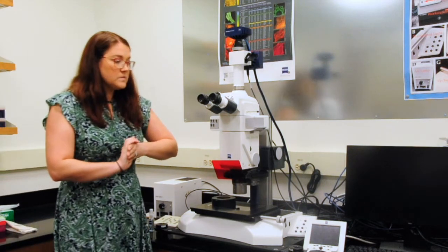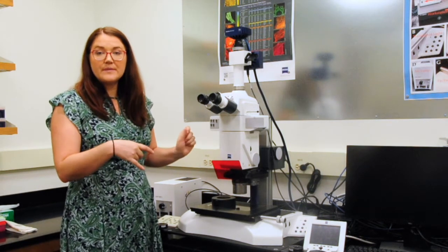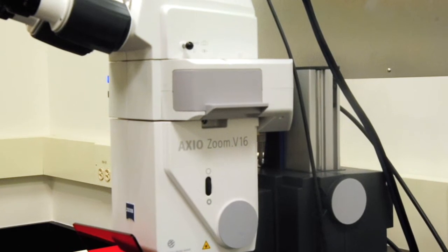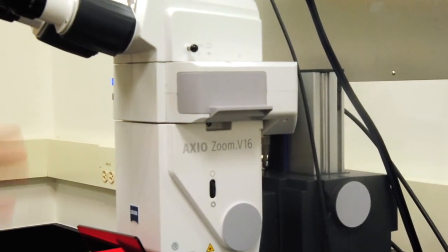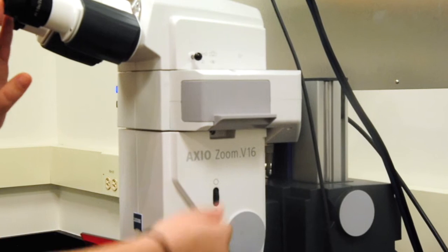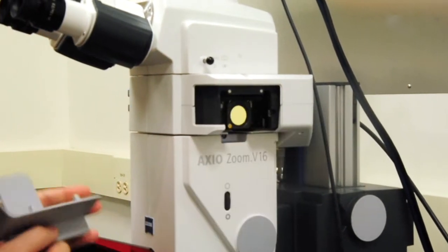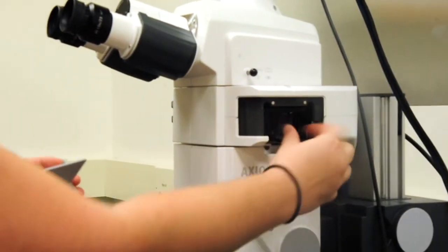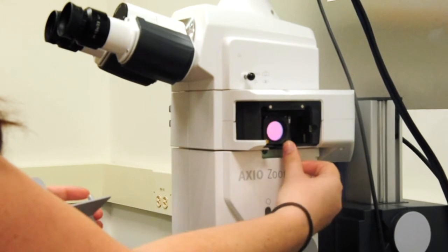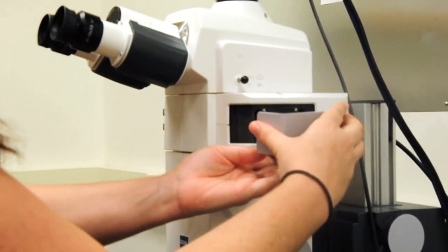And with that, we can come in and look at some of the parts more closely. And now that we're close in, we can actually look at the different parts of the microscope on the one side. So when I open this up here, you can actually see the different filter cubes. And I will put this back on.